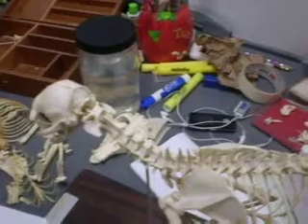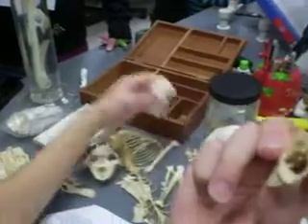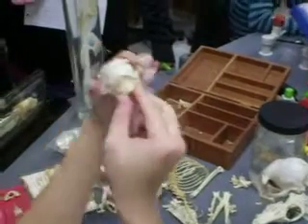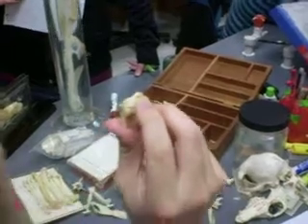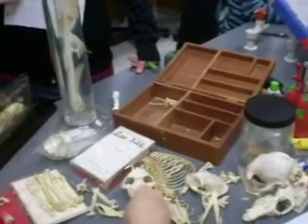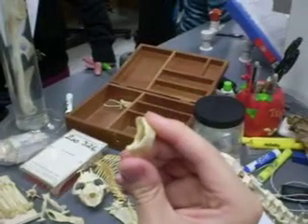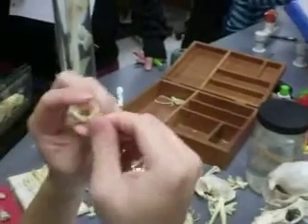Okay? And then this part of the atlas will directly articulate with this part of the cat. What did you say the name was? Atlas. Okay? So the atlas has the vertebral artery hole, which is right here.